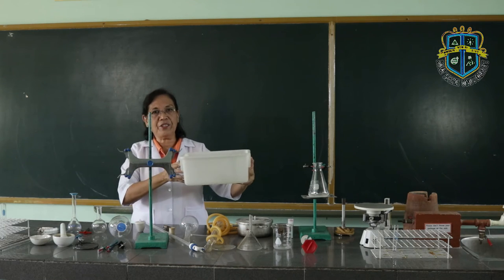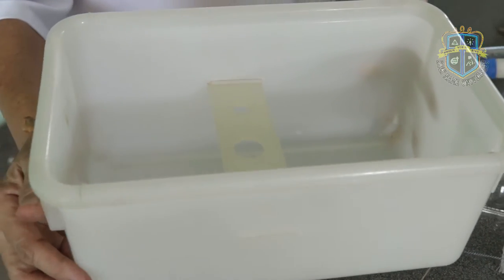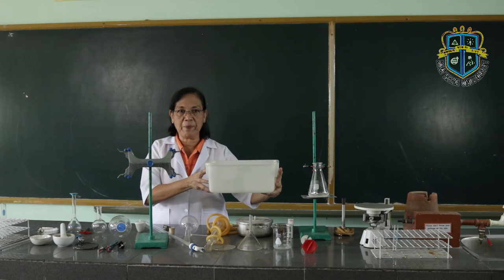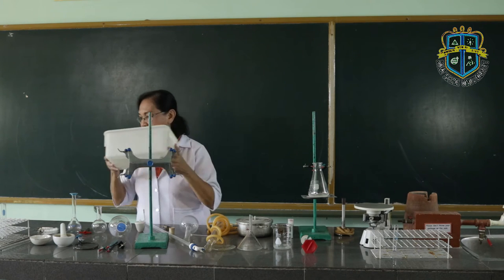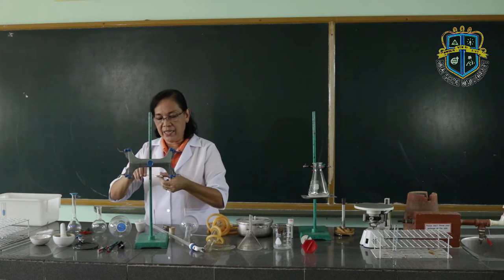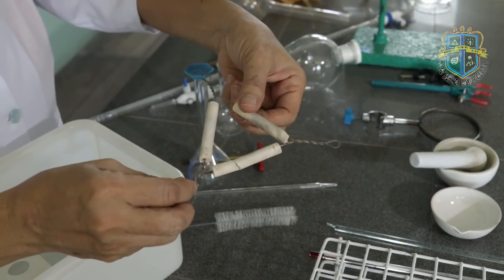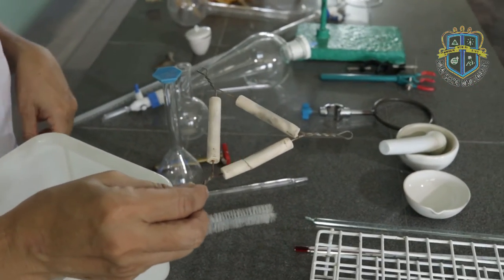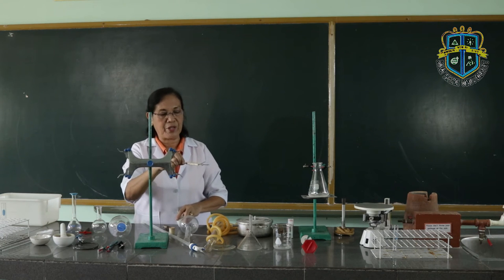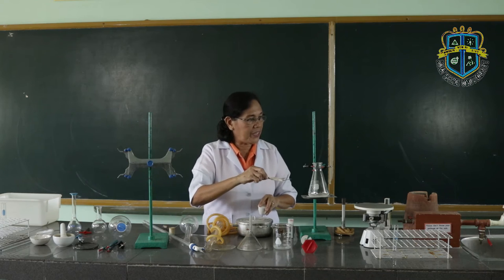This is the water trough. The water trough is used to contain water, especially for experiments that need the water displacement method. Then this is the clay triangle. The clay triangle is used to support the crucible when you are going to heat something inside it, and this is supported by the iron stand.